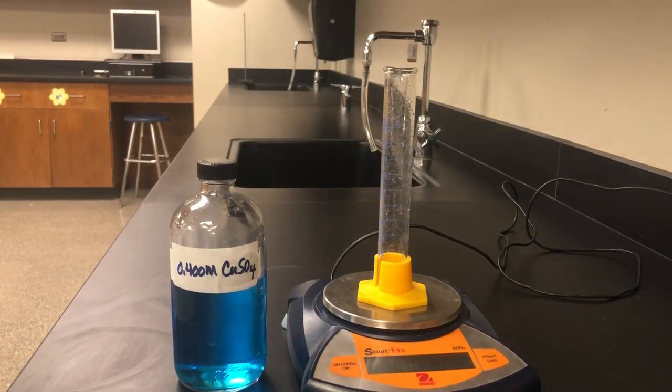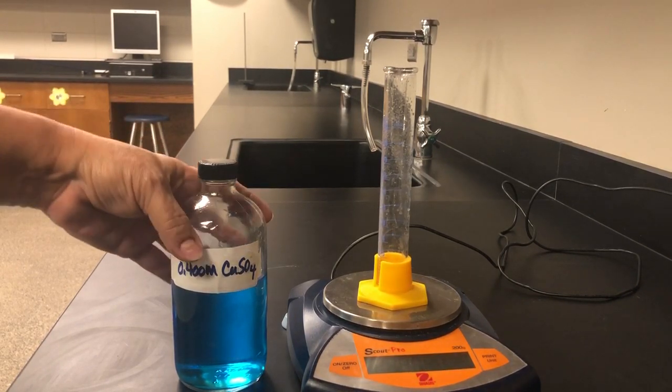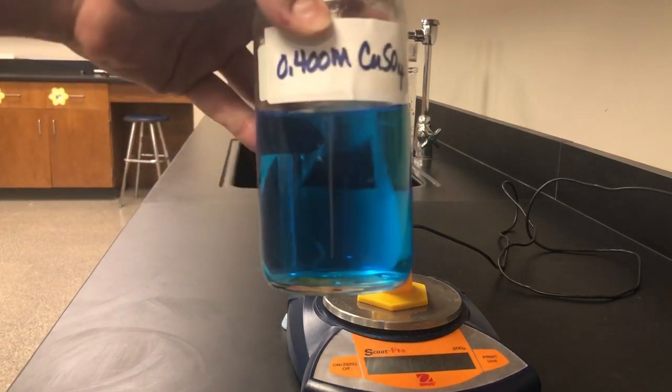Today we're going to do a lab activity on quantitative versus qualitative data. To do that, we're going to use an aqueous solution of copper 2 sulfate.